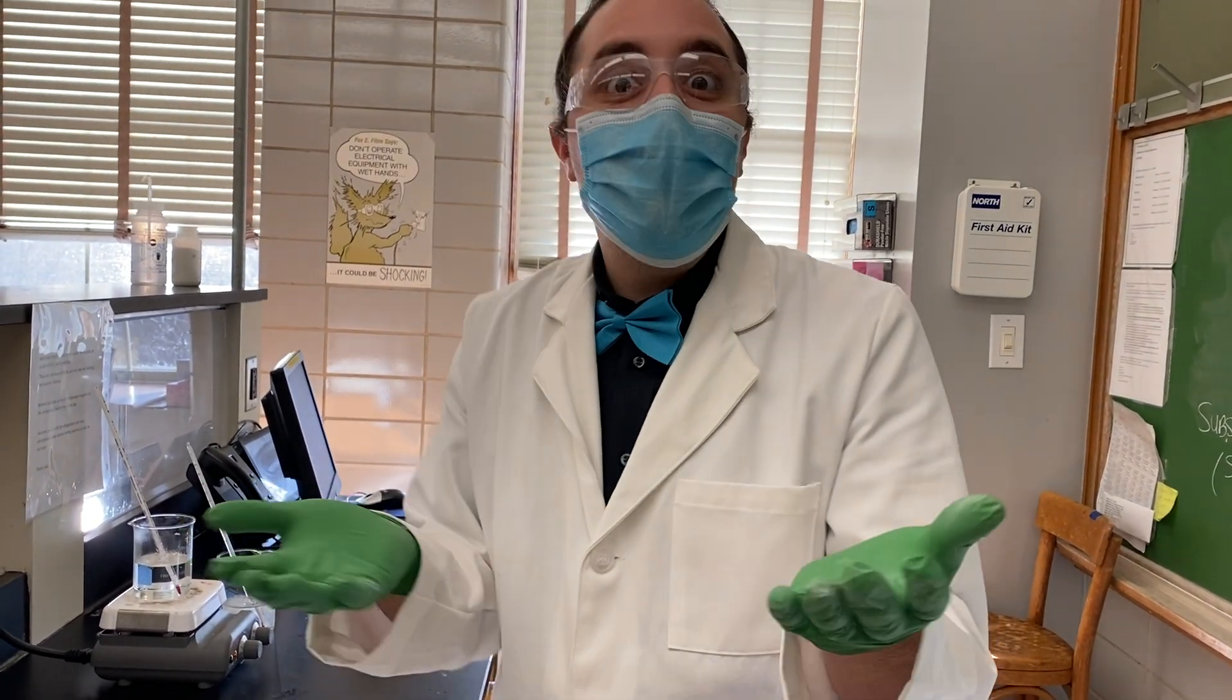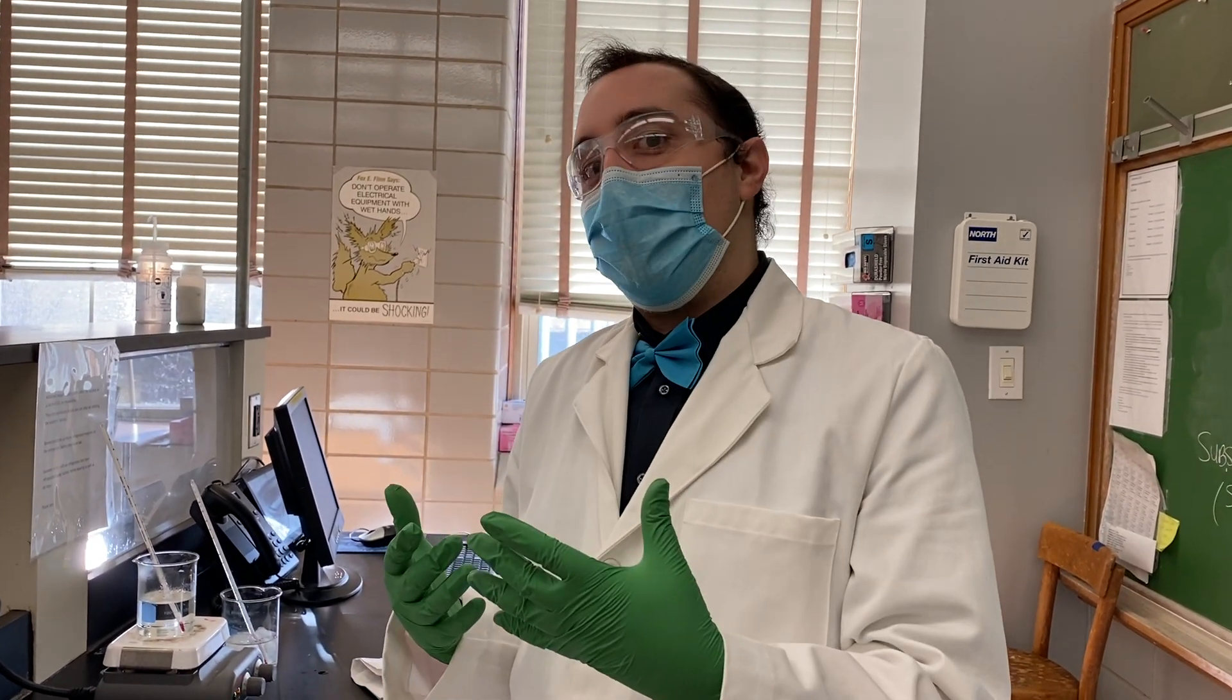Part 3 pH. Has it been 15 minutes already? I feel like I just talked to you. Here we are 15 minutes later. We're checking in with our four test tubes at different pH values.